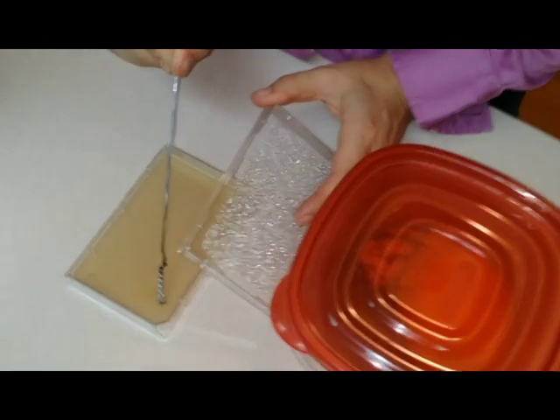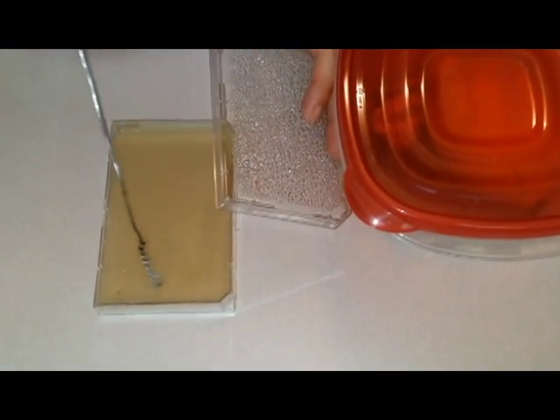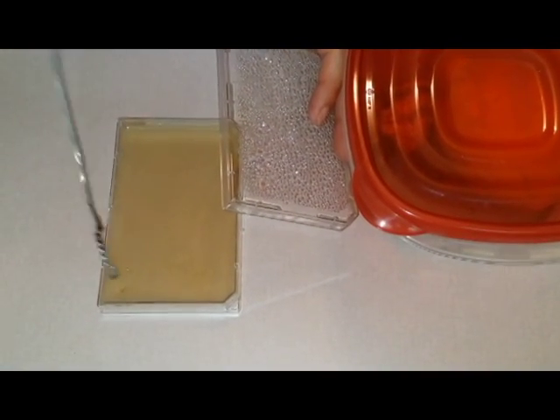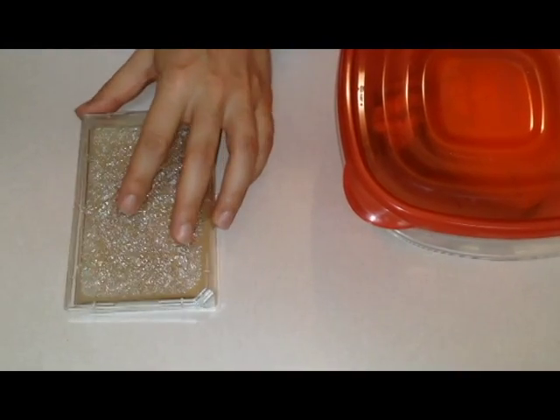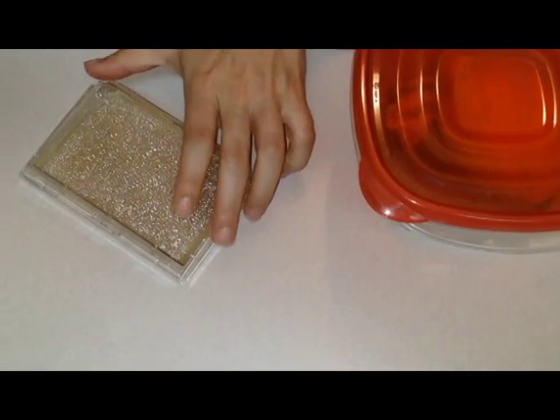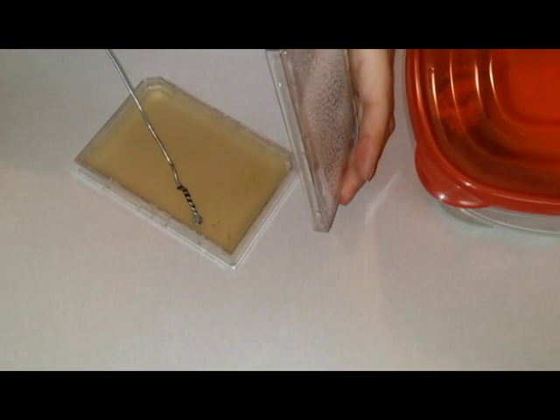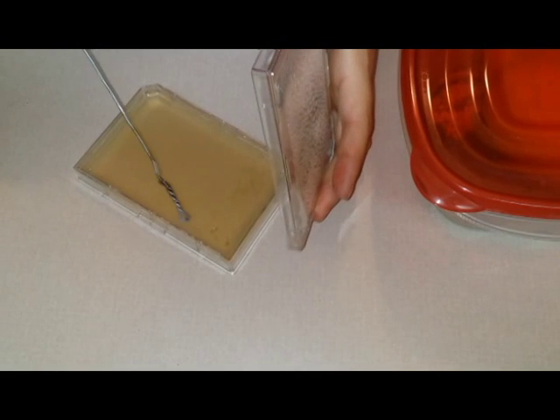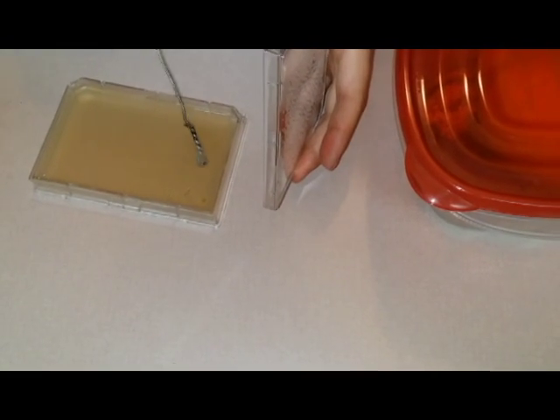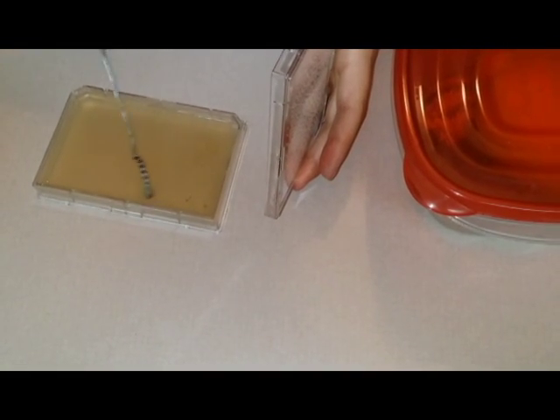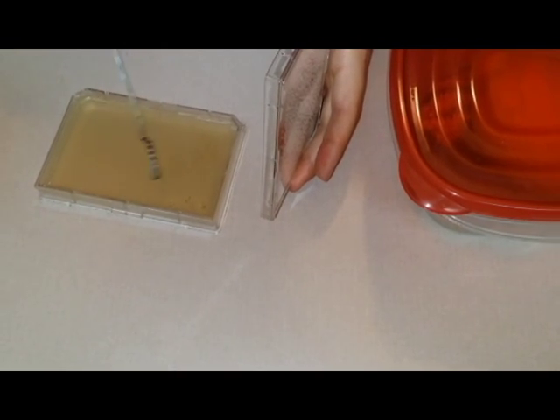So three parallel lines. And then we'll close it and we'll turn it over. Very good. And then once through the lines and then two more times not through the lines.